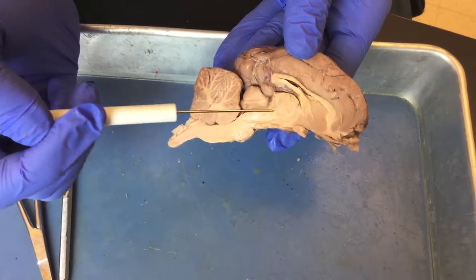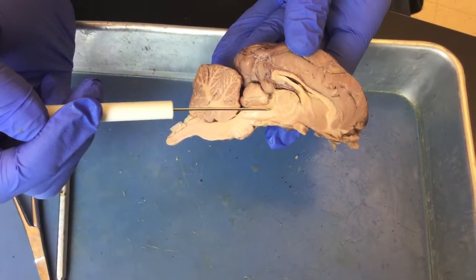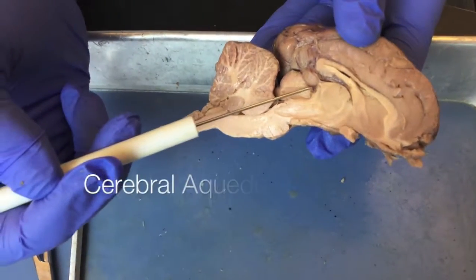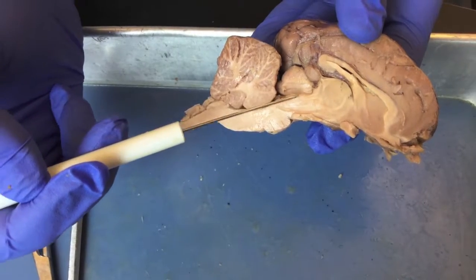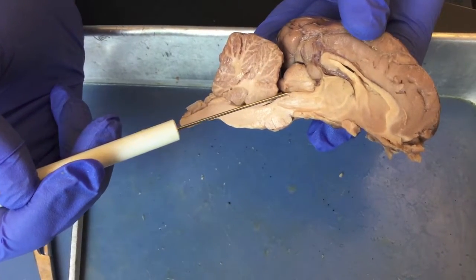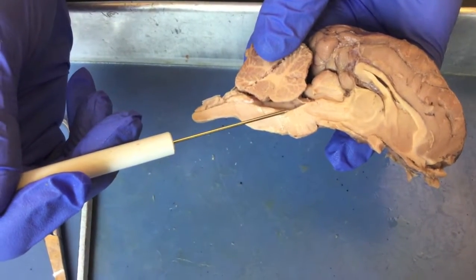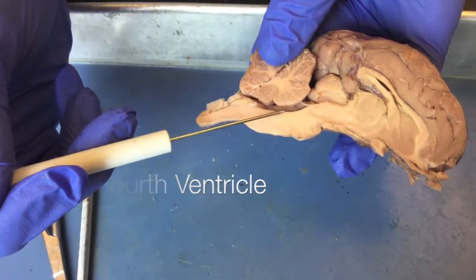located. The third ventricle then circulates that cerebrospinal fluid through a structure called the cerebral aqueduct here, which is a thin, narrow space through the midbrain. And the cerebral aqueduct then circulates the cerebrospinal fluid into the fourth ventricle here, located between the cerebellum and the medulla oblongata.